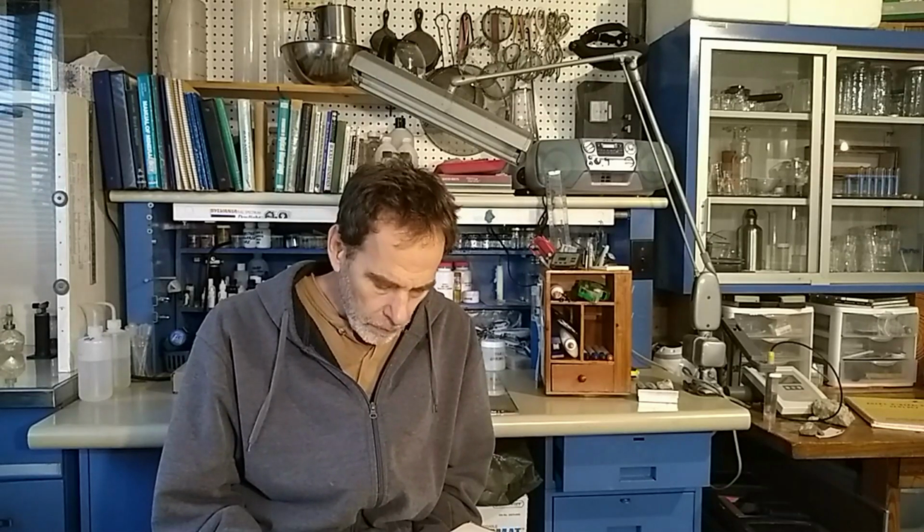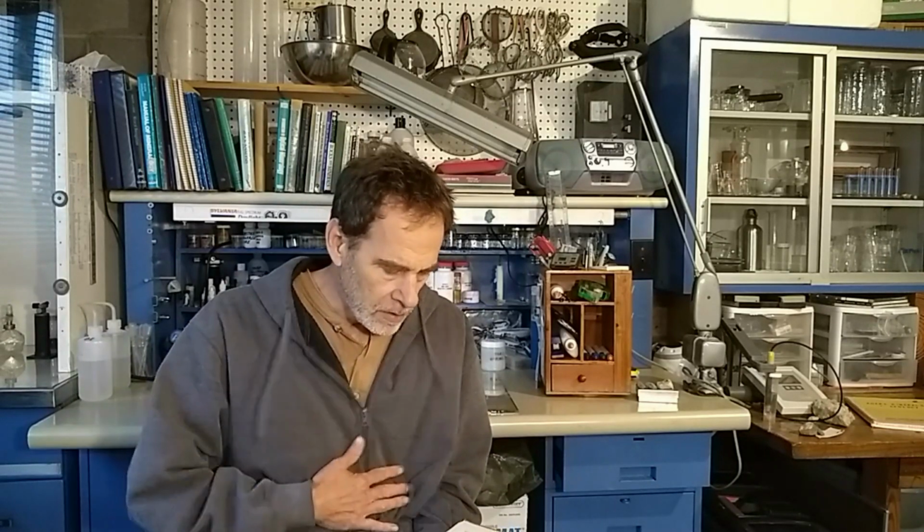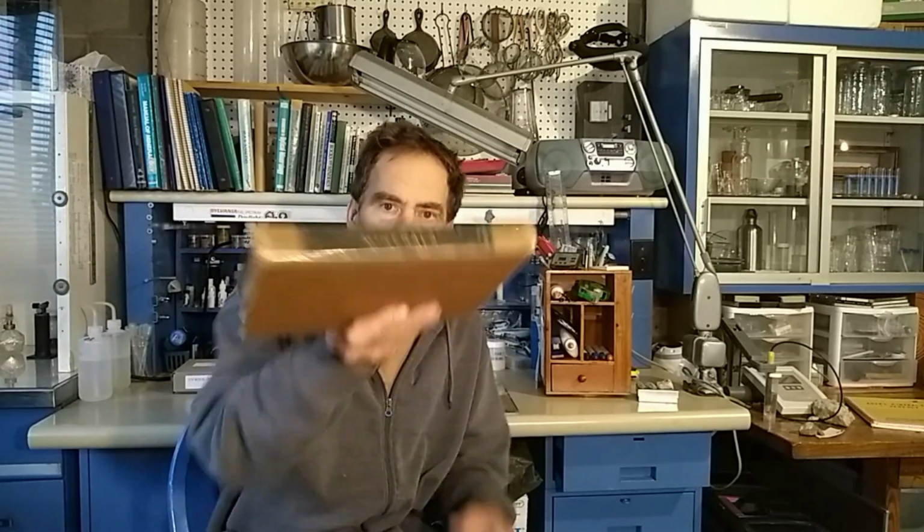So instead of doing a full-blown analysis, I'm pulling out my trusty book, Orsino Smith, Identification and Qualitative Chemical Analysis of Minerals. I don't know if that comes out on the camera. But he does have a table here for a series of 3 drop tests. Basically, you use a little spot plate and you put a little drop of the solution that you want to test, which is actually the mineral that you've dissolved and gotten into solution somehow.